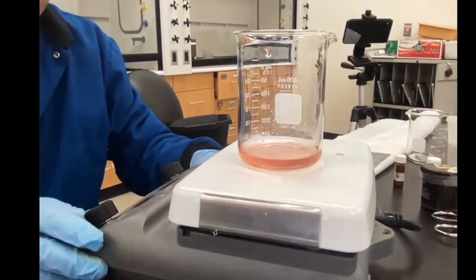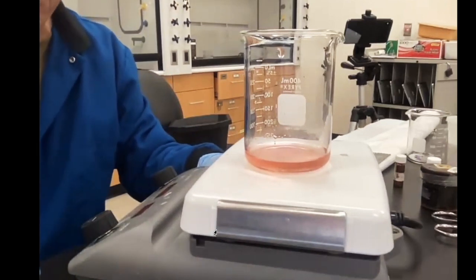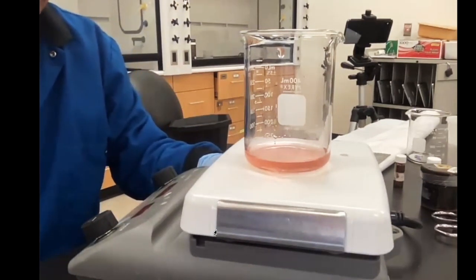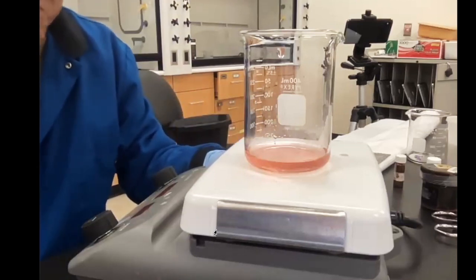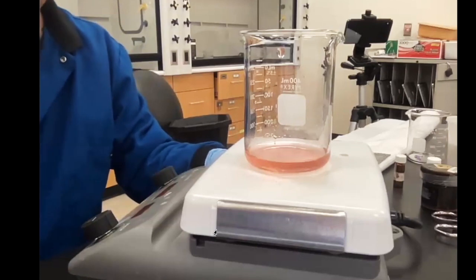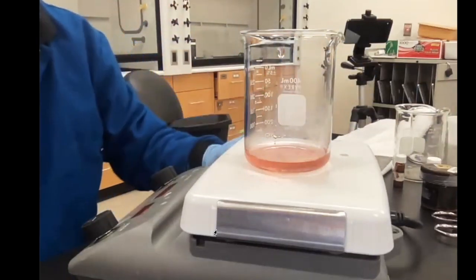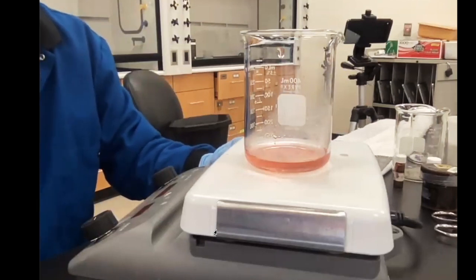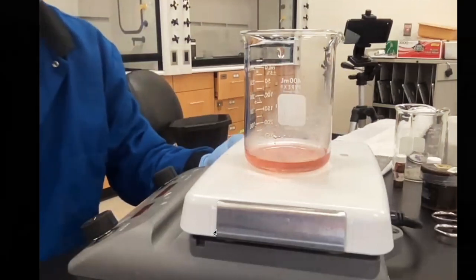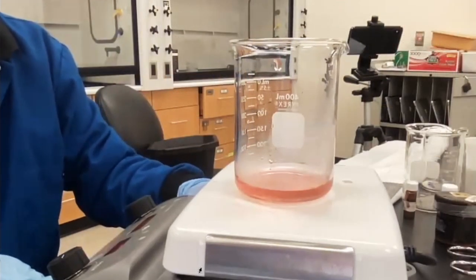So if you have something to do, then do so, but we're just going to, in real time, like if you were doing the experiment, this is what you would be looking at. You'd be bored, of course. Actually, you'd be answering some of the questions. In fact, you could probably answer some of the questions just based on this video, but you still have to do it. Okay, I want you to go through the trial because you do need to take a picture of it. But you could probably start answering some of the questions because you already have some of the observations. You could answer some of the questions already just based on what you've seen.